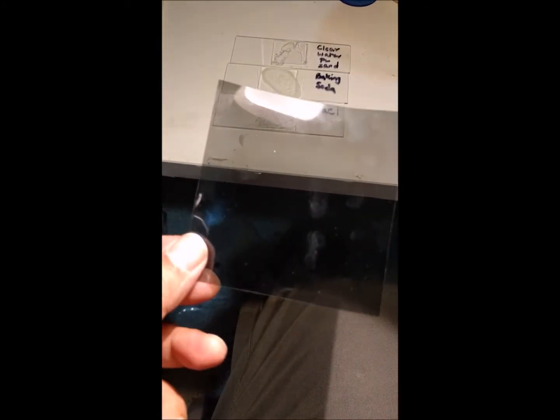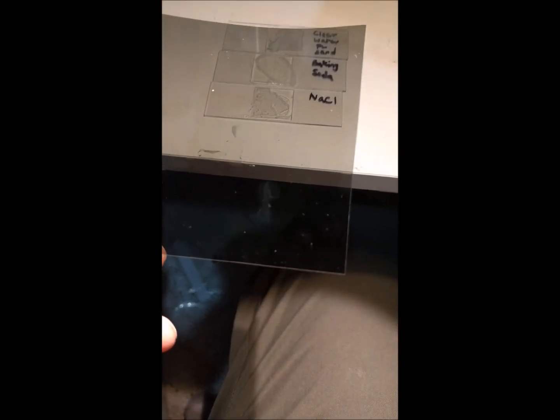For this, what you need primarily is a polarizing filter. This is something I bought off the web, it's not very expensive. You can also get such kinds of filters from 3D glasses, which are basically polarizing filters.